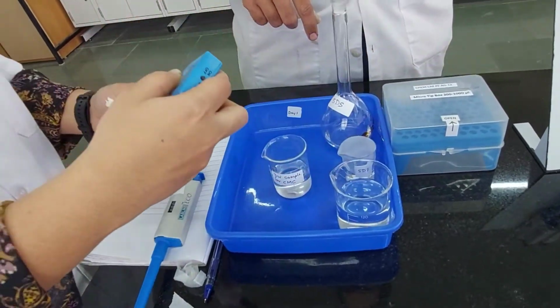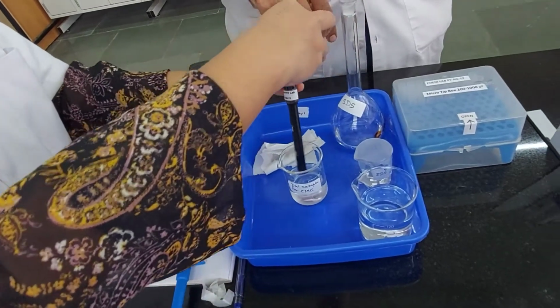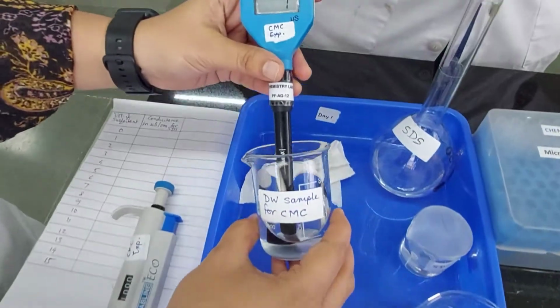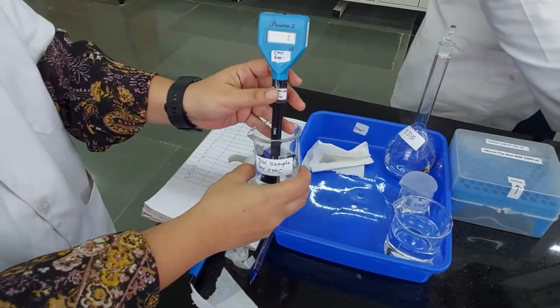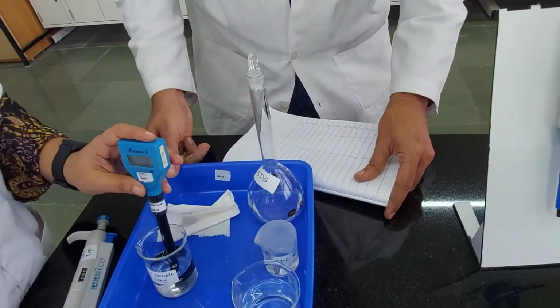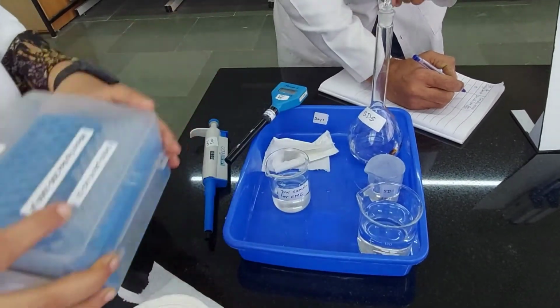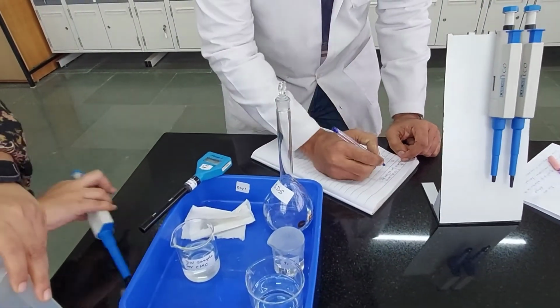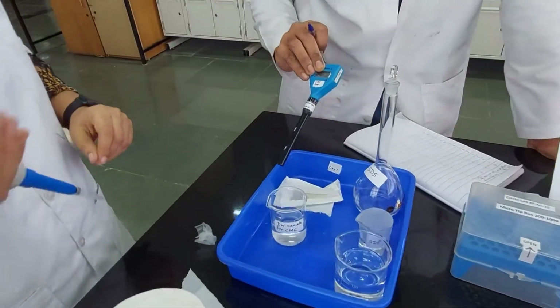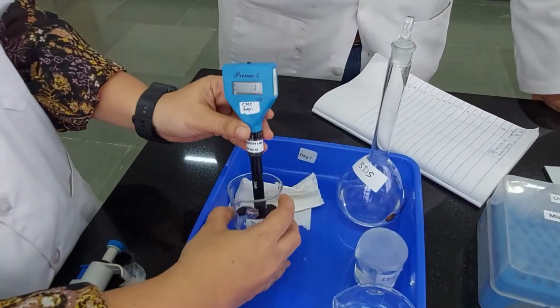First we will be cleaning our probe. It's nice and clean, dry. Then we will drop it in distilled water for the CMC experiment, and there is no conductivity here. As Sonali adds SDS, I will note down the readings. The first reading without any additions says 1, and we are going to keep our probe in the solution from thereafter. Once we put it in, we won't take it out. So the probe goes into the water. Let's check the reading again.